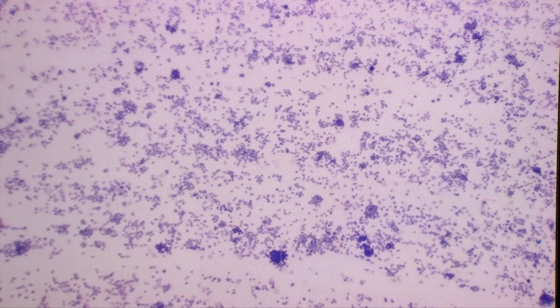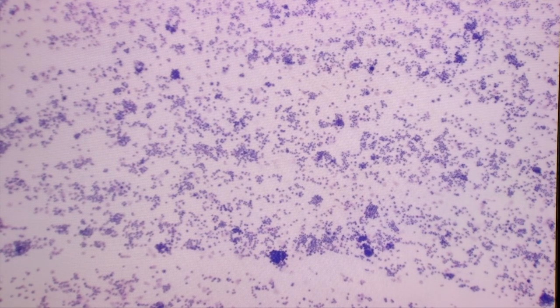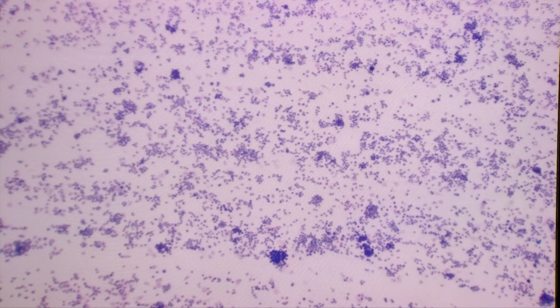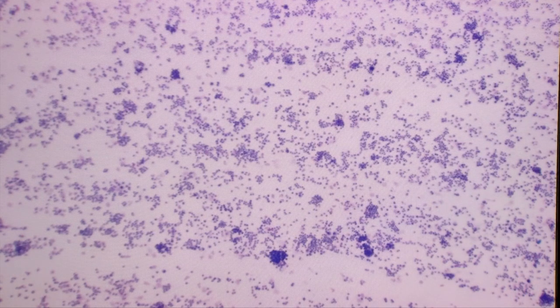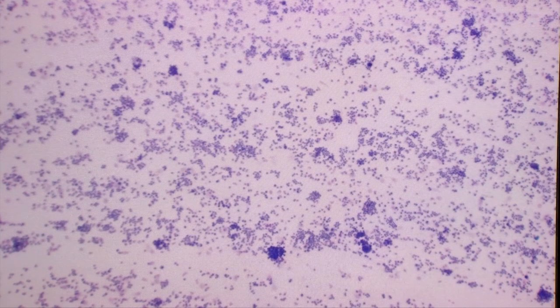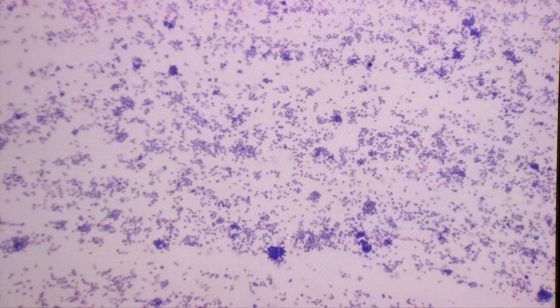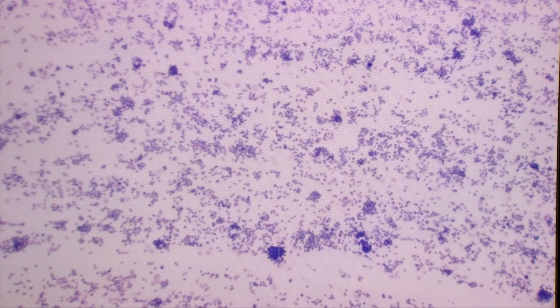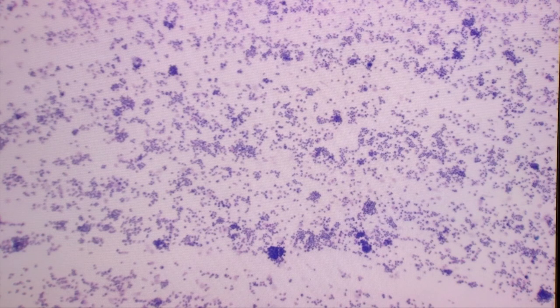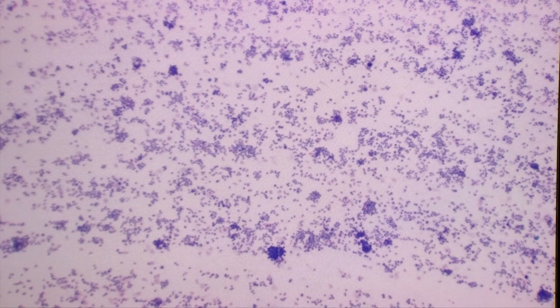To begin with, we would start on a fairly low power — right now I'm at the 4x objective — and we want to scan the entire cytology slide. We look to make sure that the types of cells we're seeing throughout the smear are similar, because sometimes you may have clumps of cells in one area and other cell populations in other areas. So contrary to a blood smear where we may focus mostly on the monolayer, with a cytology smear we have to evaluate the entire smear.